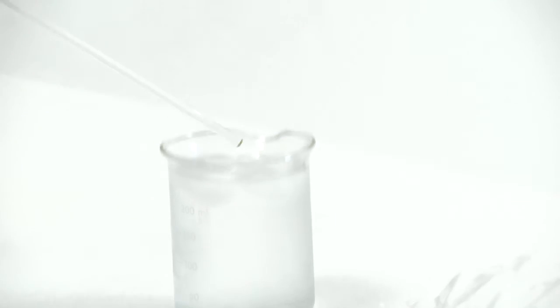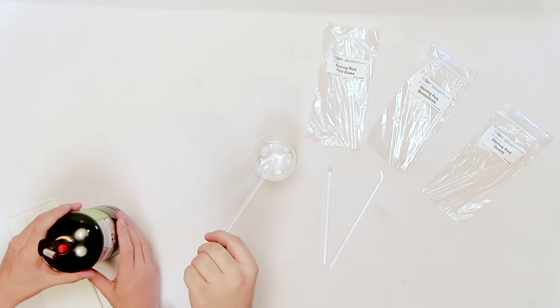Remove from the flame and quench. The rod will not thermal shock and no cracks should occur.